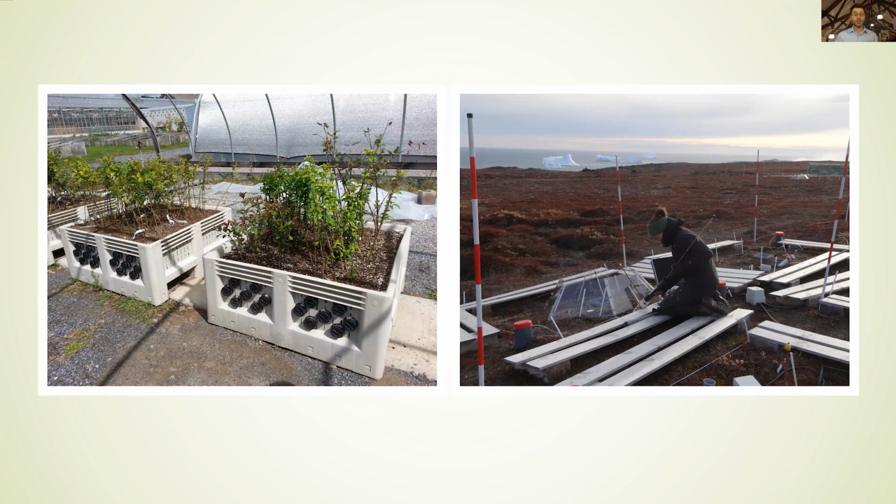On the right, this shows some of its ability to work pretty much regardless of the environment. You can see it being used on the tundra. The 600 is doing scans there, and we found that it's actually the acrylic tubes that have more problems with the cold than the instrument itself.